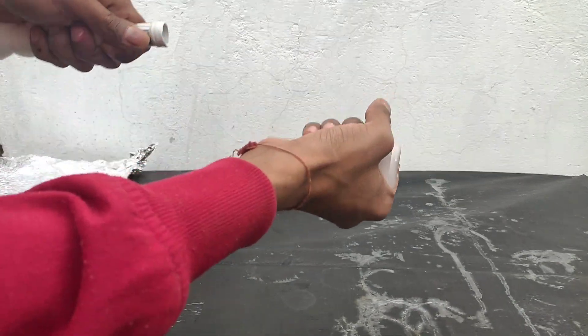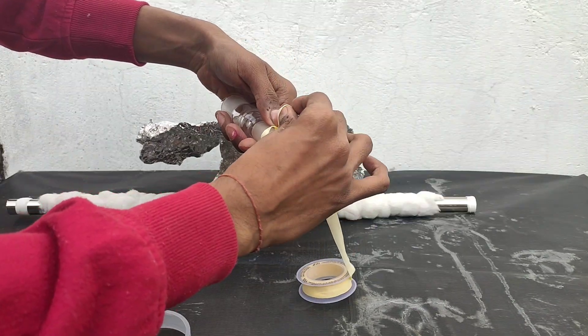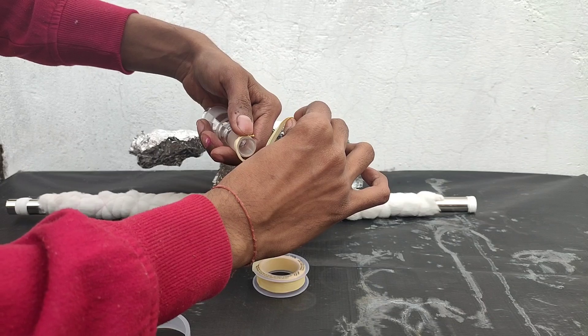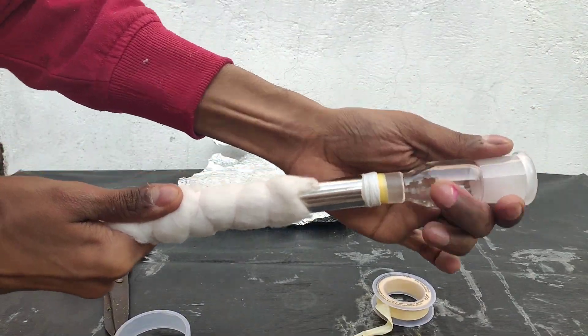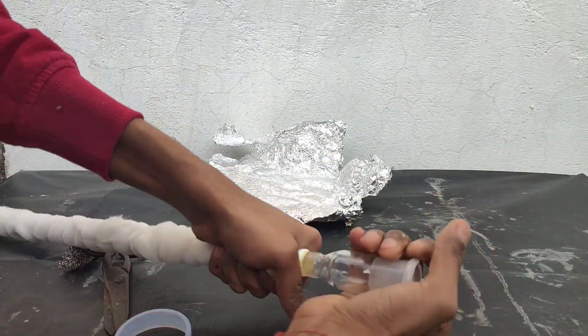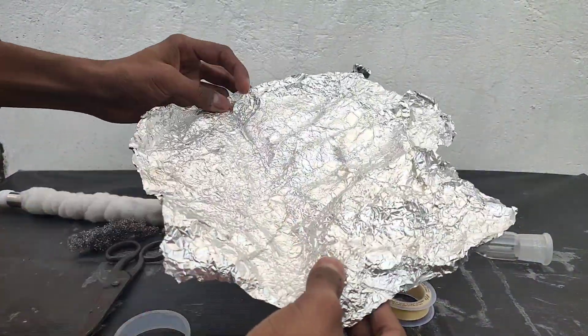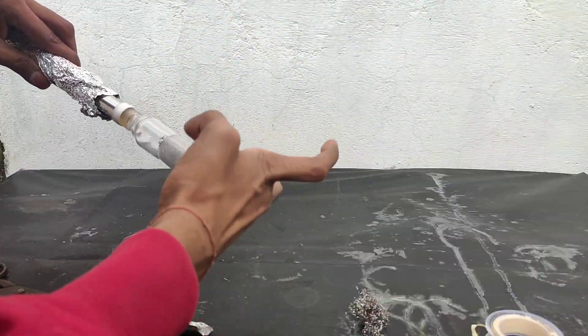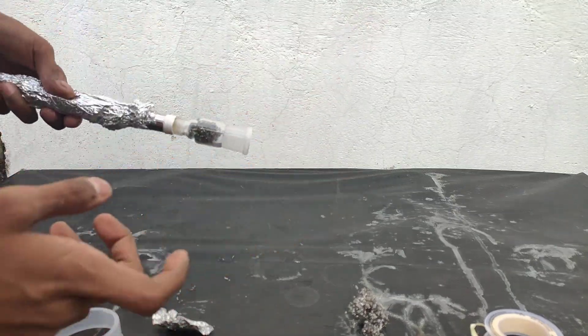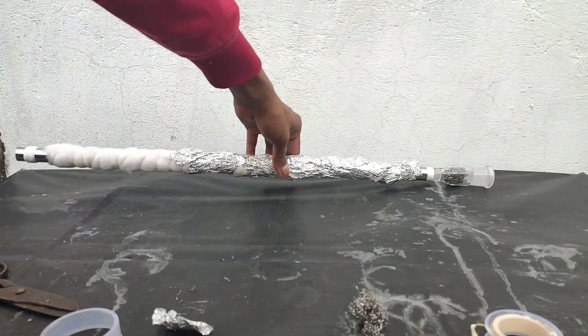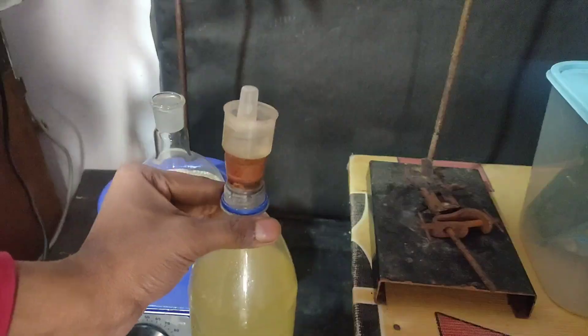Now to fix this enlarging adapter, I wrapped some teflon tape at the cone of the adapter and fixed it tightly at the top end of the column. For better insulation, I wrapped the column with aluminium foil and inserted a bunch of steel wool in the adapter for condensing some of the vapour to start a reflux.